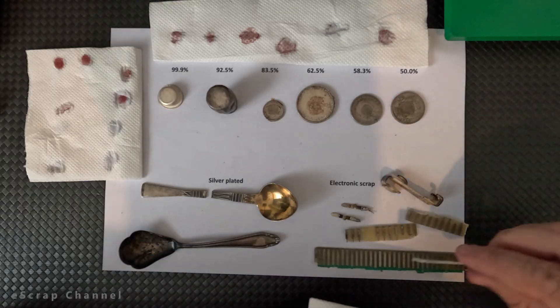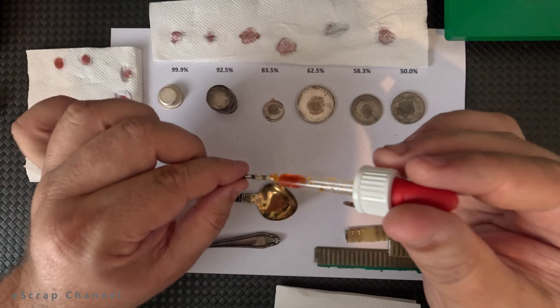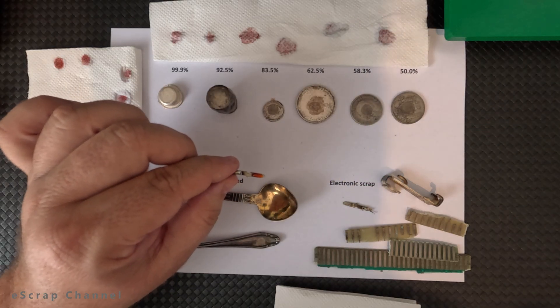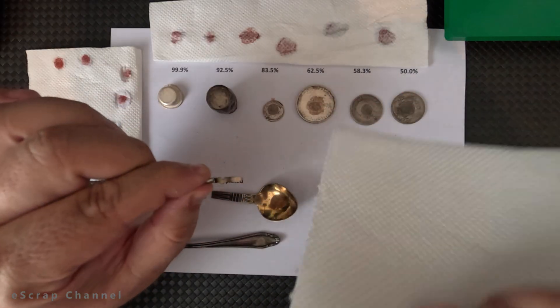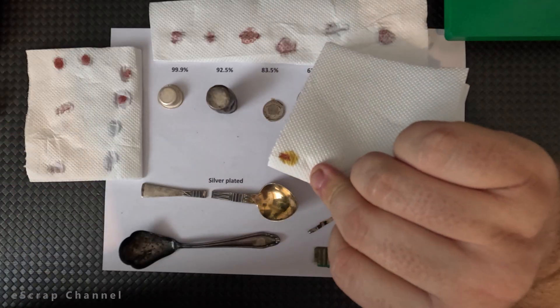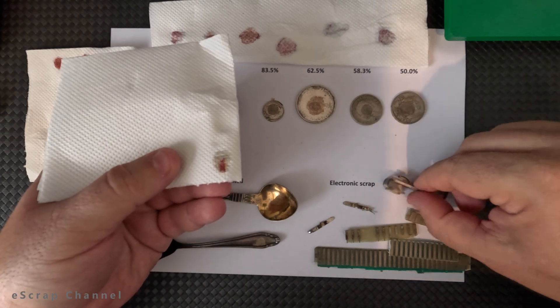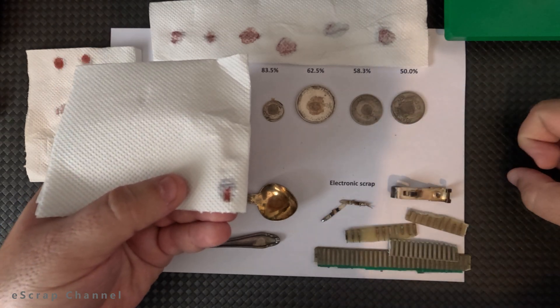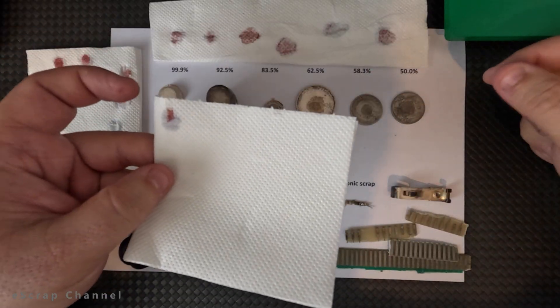Let's go to another electronic scrap. In many cases you have pins and you are wondering if these pins are covered with silver. So you put a small drop on top of the pins and you get a nice result — you see the red color; these pins are silver plated. That's how you can identify silver plated pins and sell them or process them for silver instead of just throwing them away as base metal.